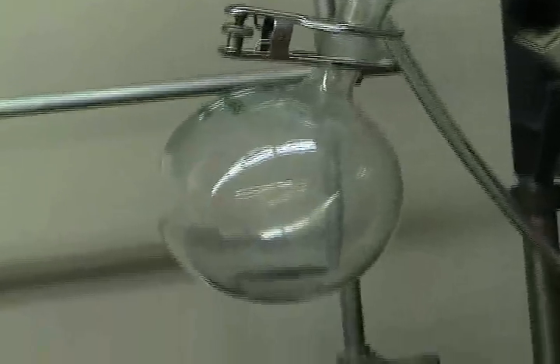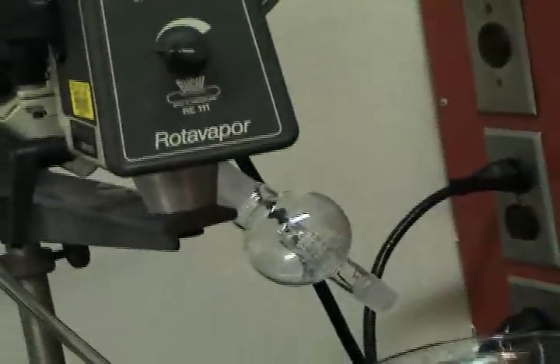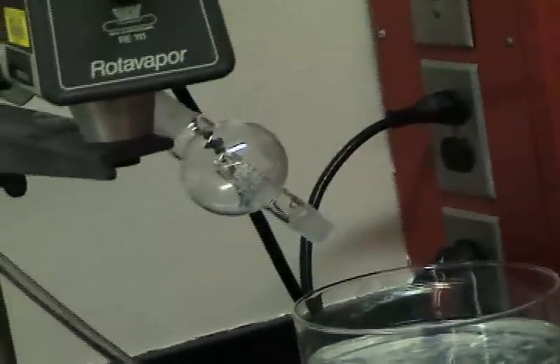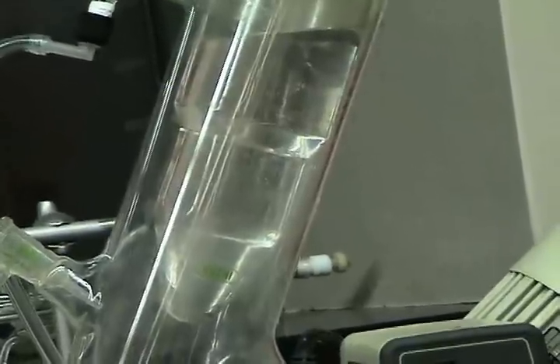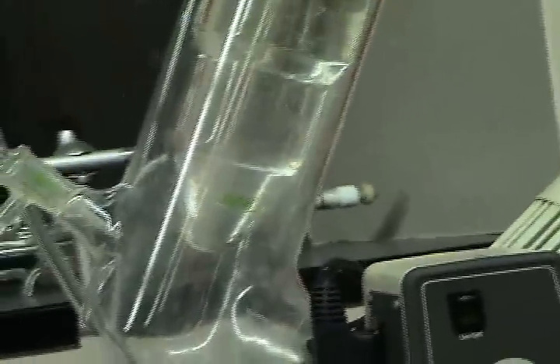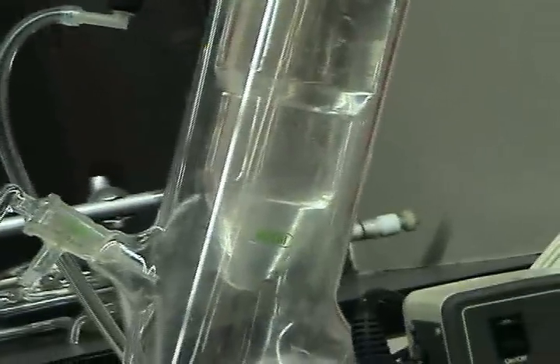The last component is the cold finger that drains into the solvent waste trap. Now, when we pull off that solvent — acetone or methylene chloride or whatever it might be — remember this vacuum is getting pulled up to the stopcock and through down to the sink. We don't want that to go down the drain. It is wasteful of solvent that can sometimes be reused, and it is illegal and a pollutant. So we have what is called the cold finger. The cold finger is basically full of a solvent that does not freeze at or below negative 77 degrees Celsius, which is the point at which dry ice sublimes. I have chosen ethanol — a lot of people choose acetone, but I think ethanol smells better.